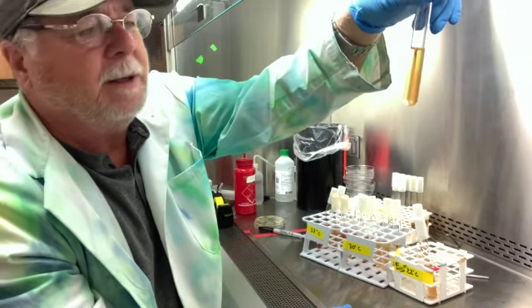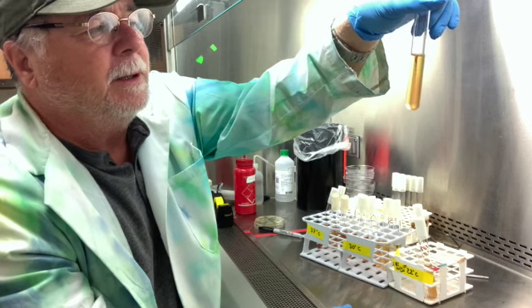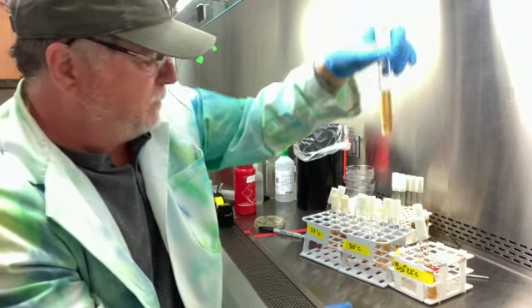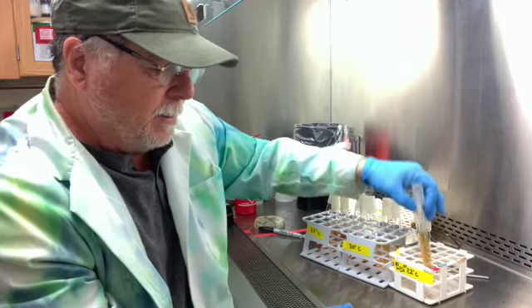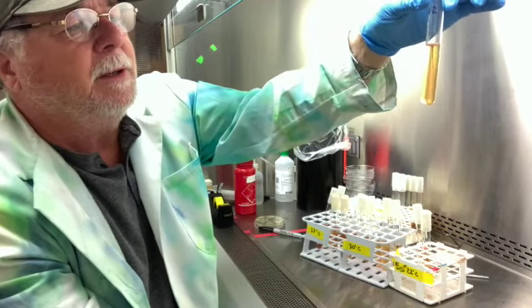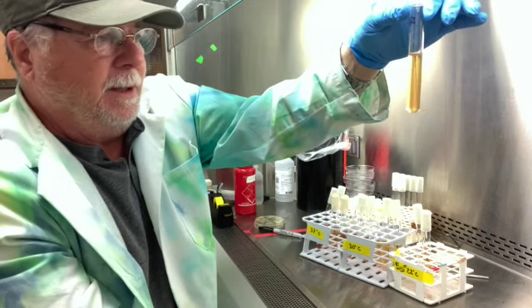Again, it is growing at the surface better and is not spreading out. So this is an aerobe, and it is non-motile. And Rhodococcus rhodochrous is number 12, and it is keeping its growth near the surface and it's not spreading out. So this is an aerobe, and it is non-motile.